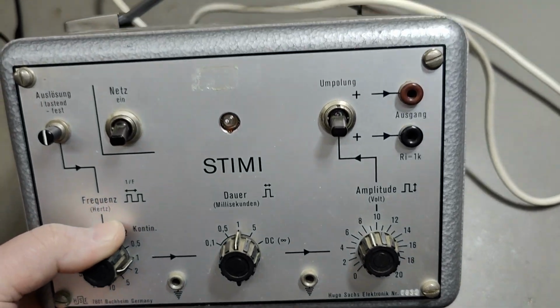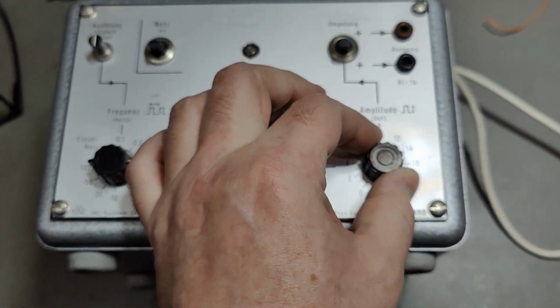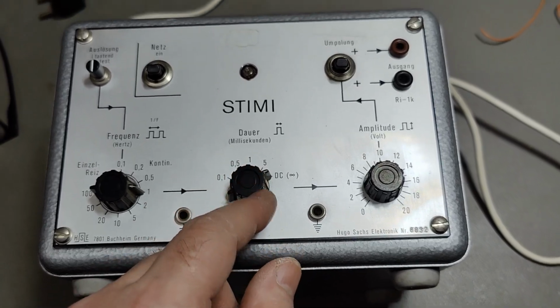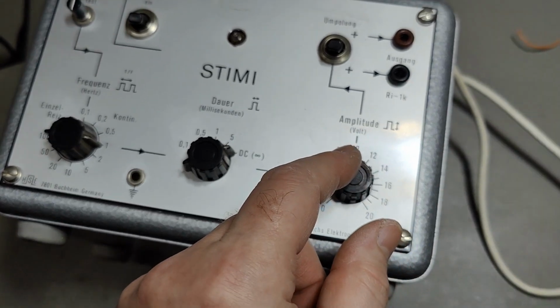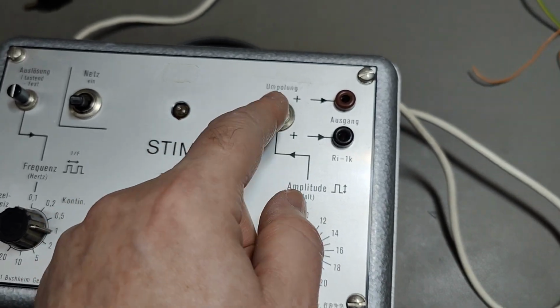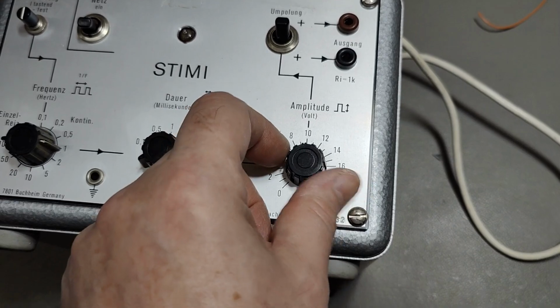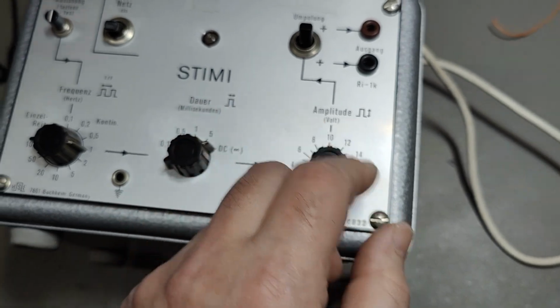I don't know how old this one is, but I think I need to open it first before I power this up. I can feel, see, there's something loose in here. DC. How can you make a pulse in DC? But I think when you go to DC, then this is just a DC voltage, right? And then you can reverse your output. So I think up here, it's positive, that one, right? And you have an internal resistance of 1K. Okay, fantastic. But this is a DC voltage from 0 to 20 volts. So it can also do that.